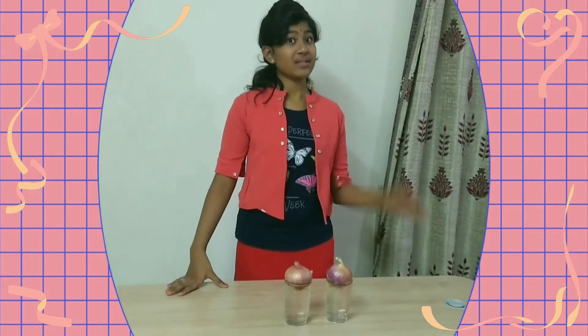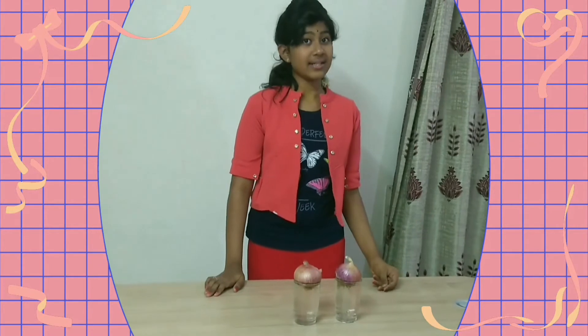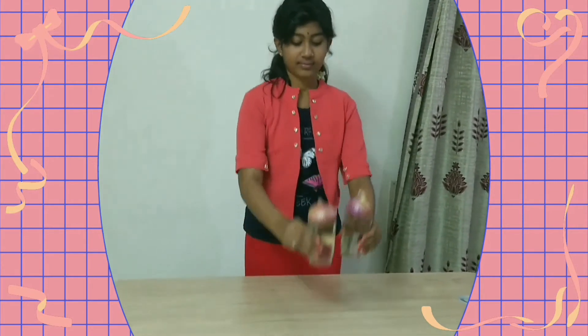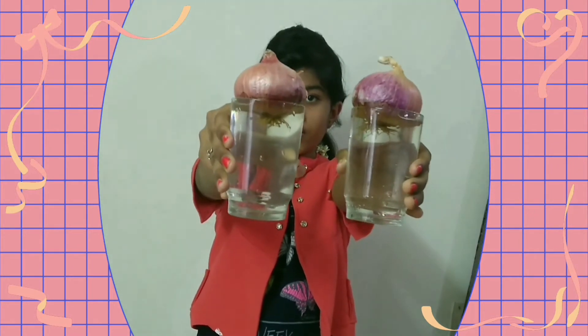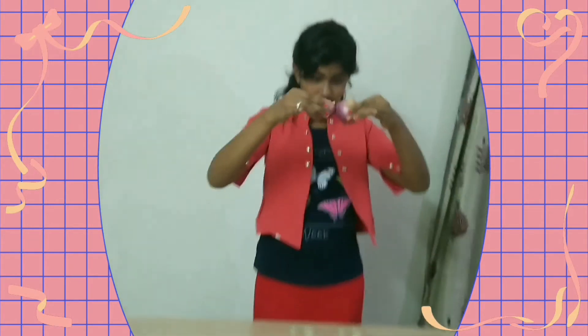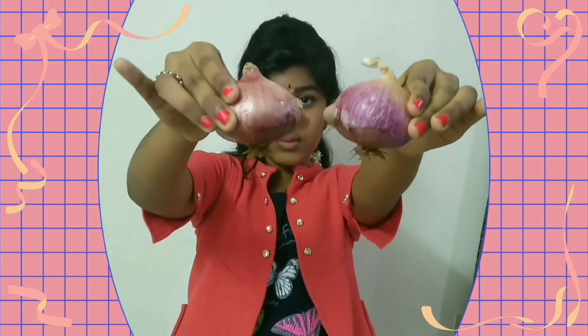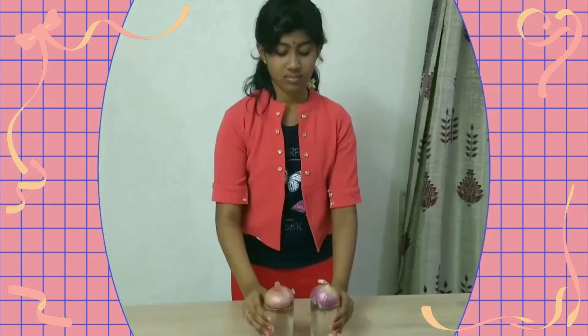Today we have completed 4 days since we started the experiment. Let's see what changes have occurred. The roots have grown a little bit. Let's observe if there is any growth tomorrow.